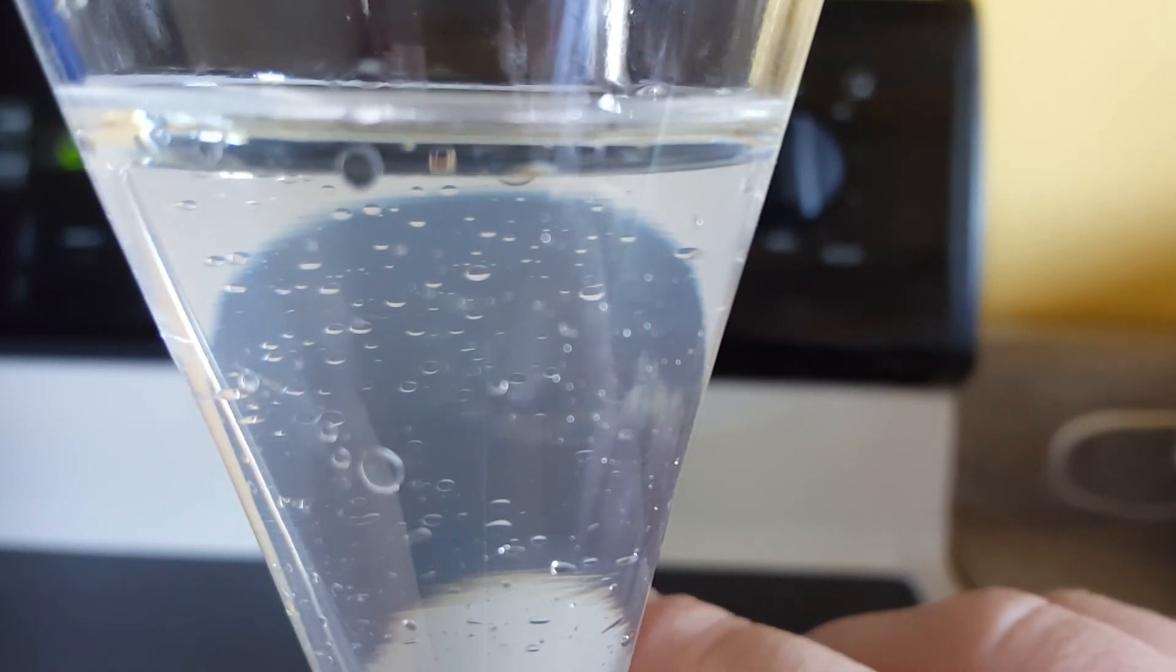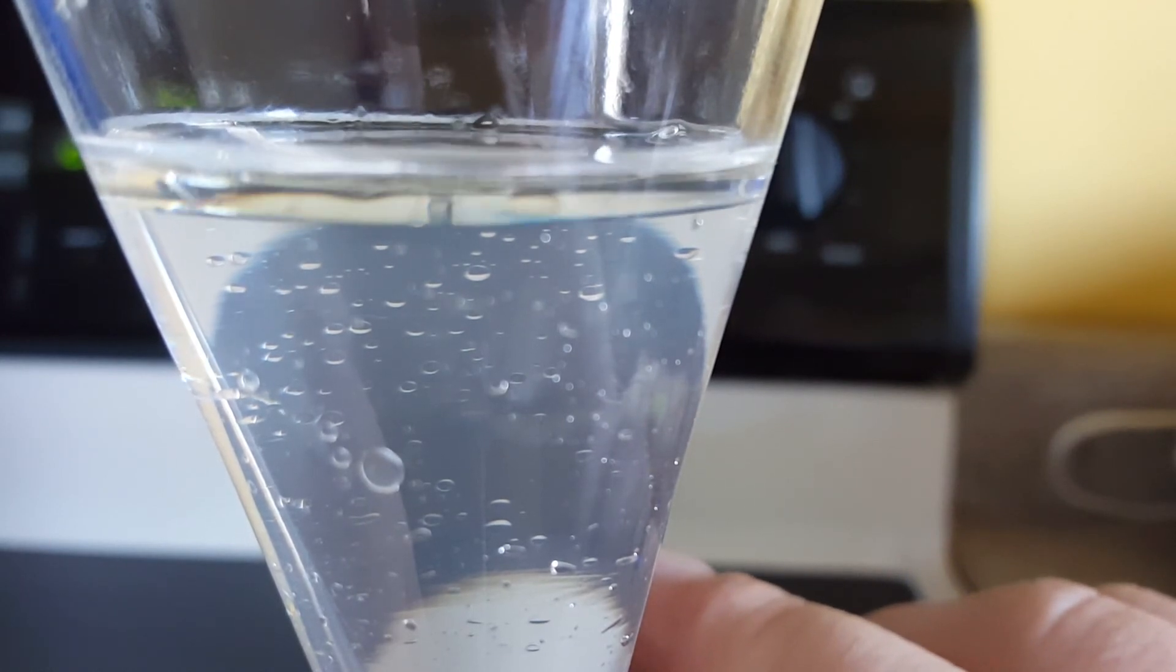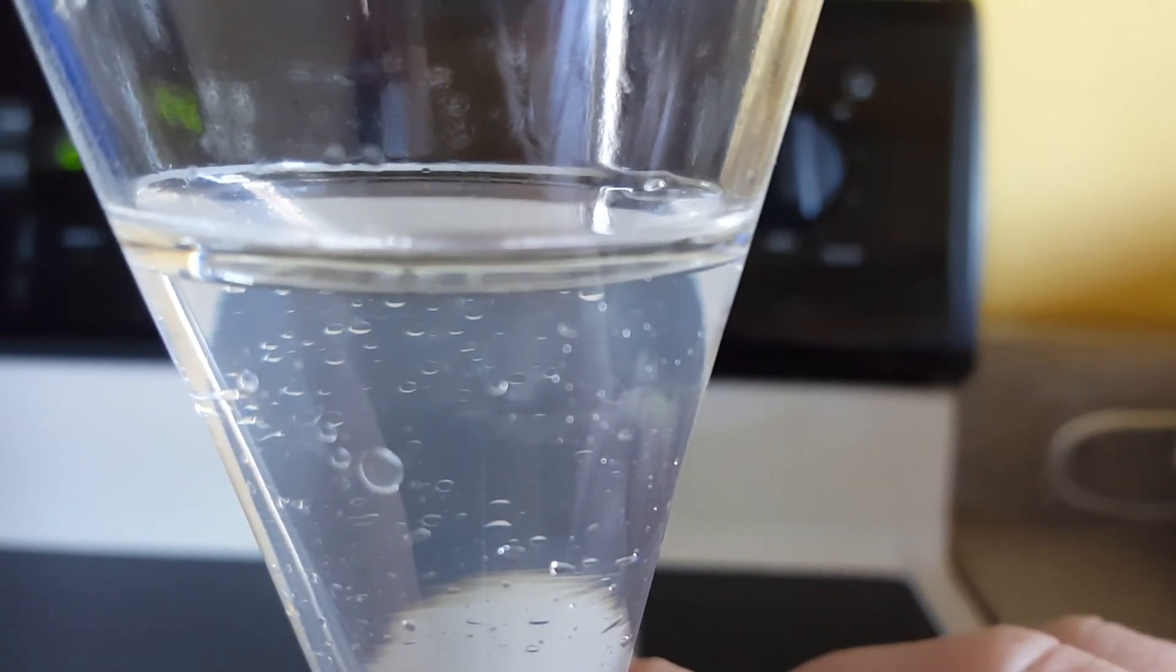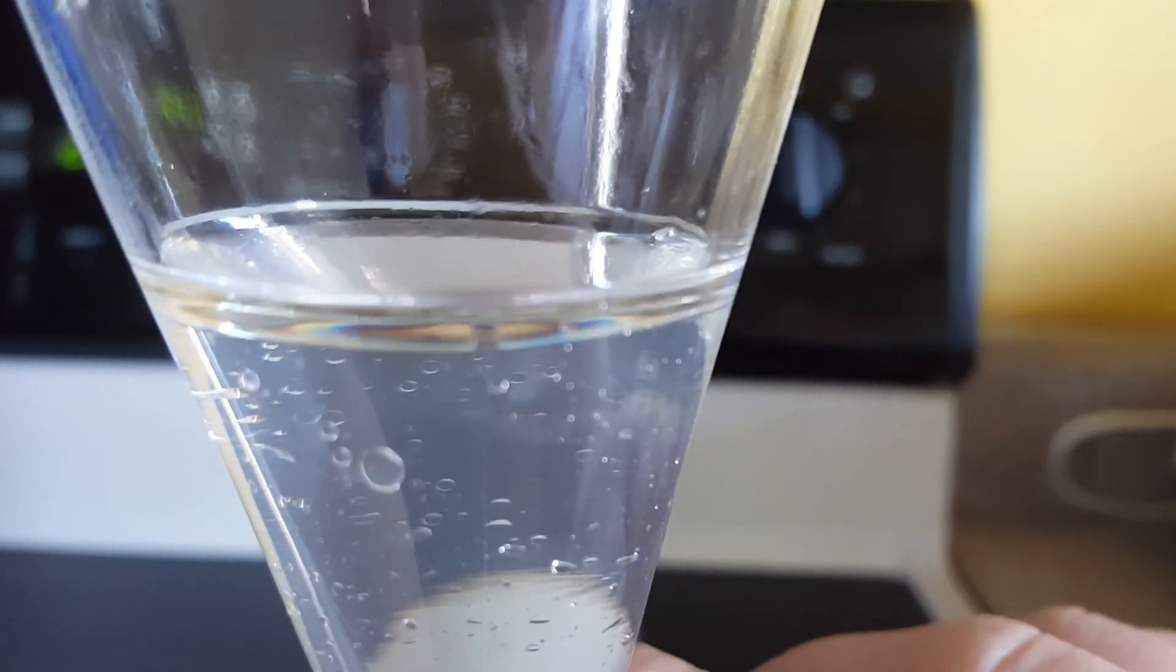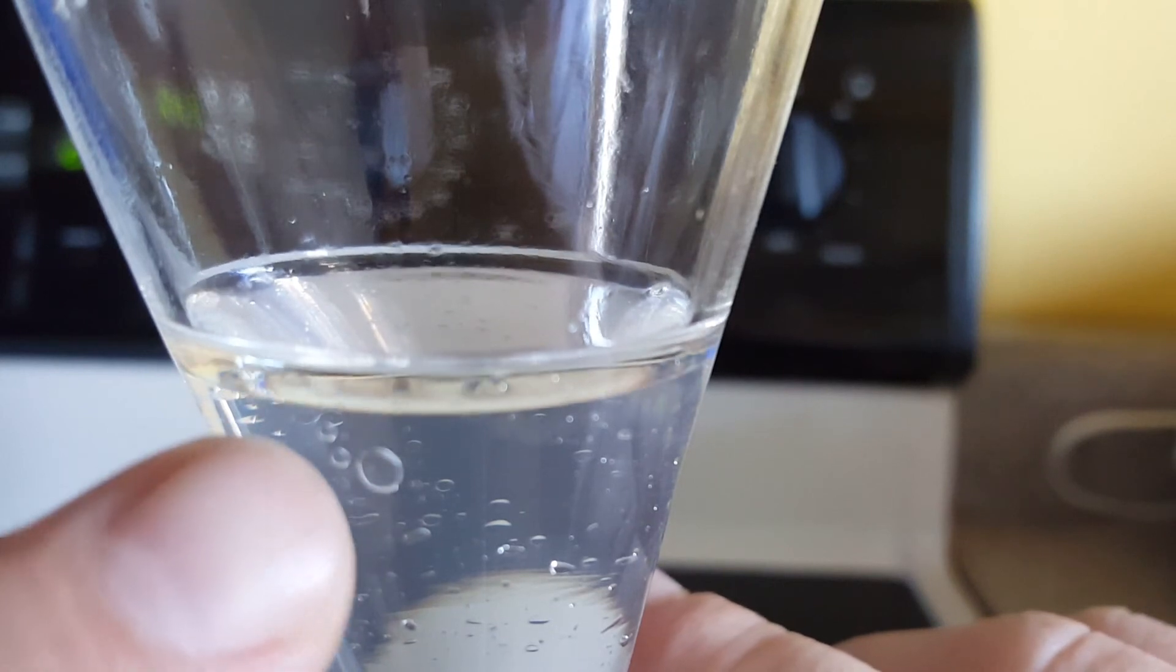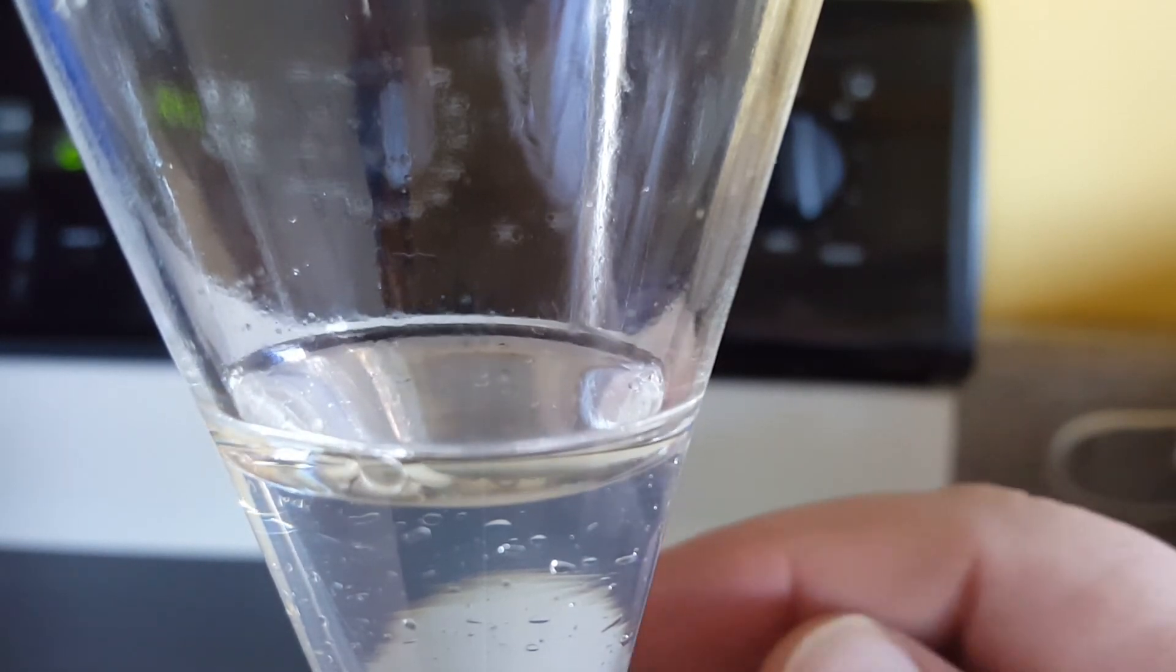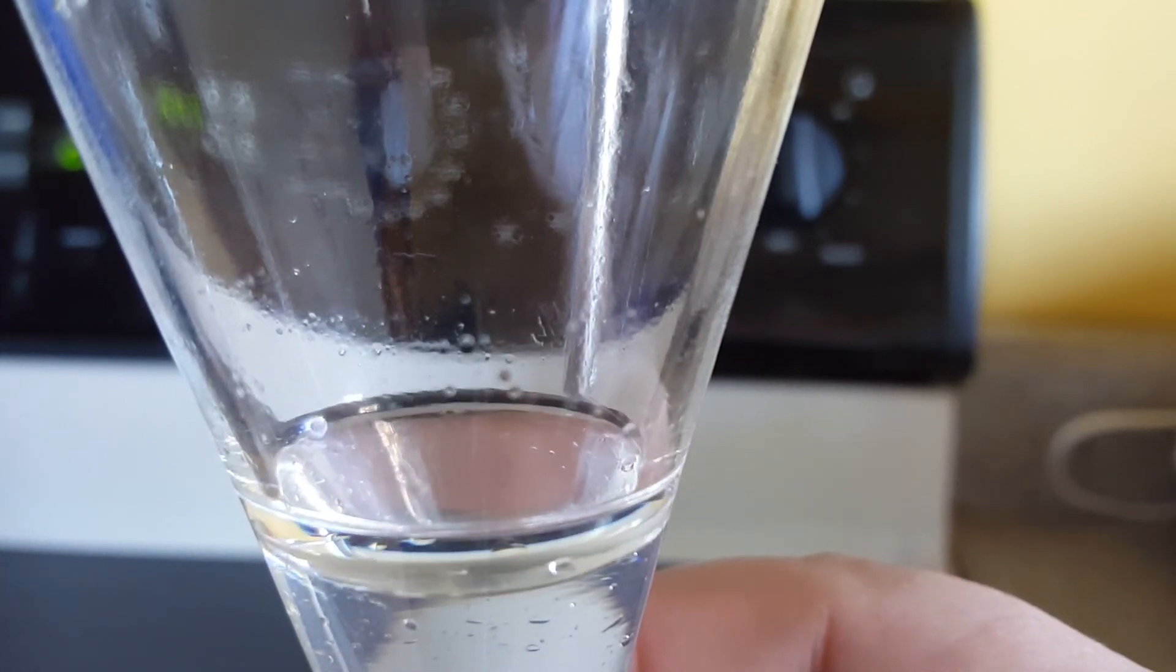Well this time the first one disappeared, let's see if the second disappears also. Yeah it did, so actually this one combined. Not the best example but I did see some other ones that wouldn't combine into the oil. Of course now that I'm trying to film this that's not happening. Let's see how this big bubble here does whether it will also merge or just stay separated.